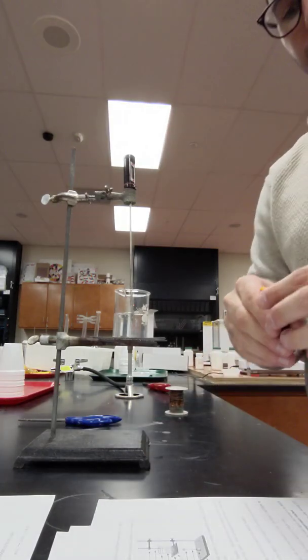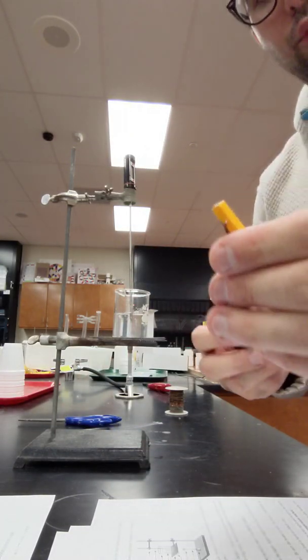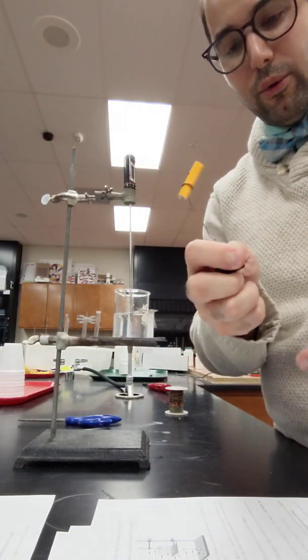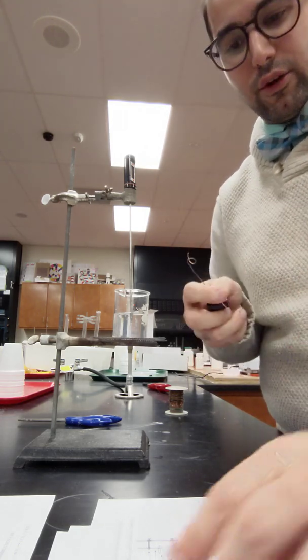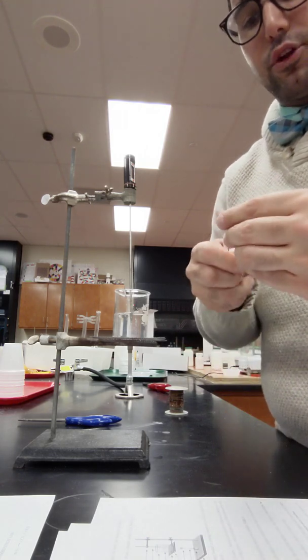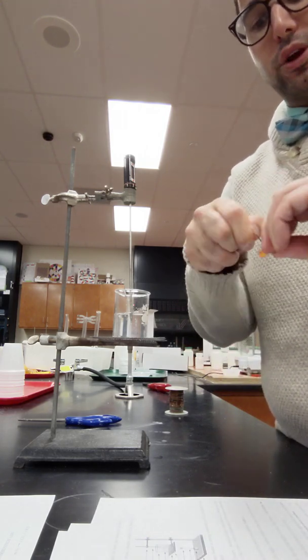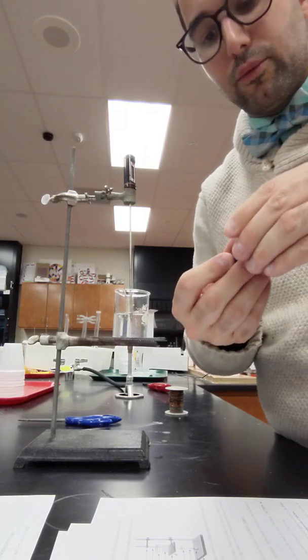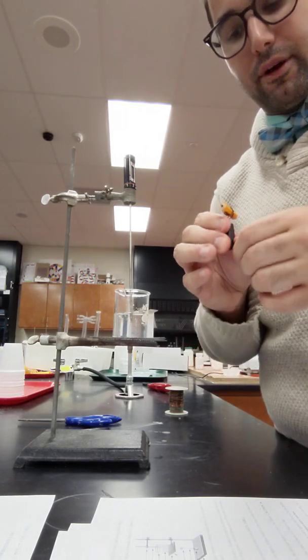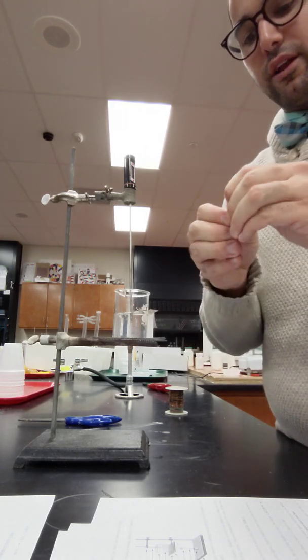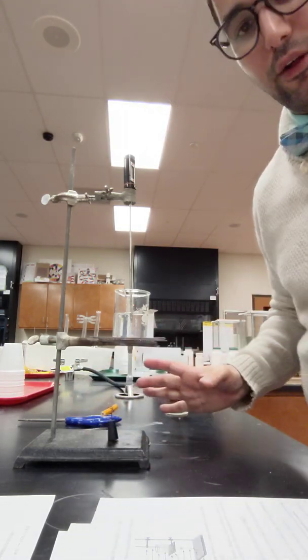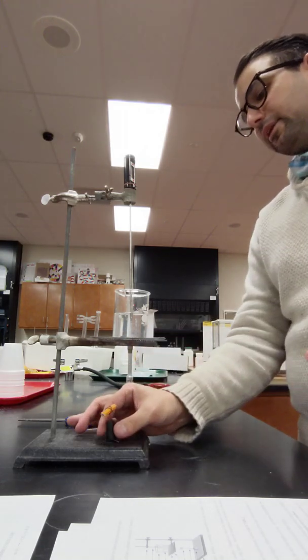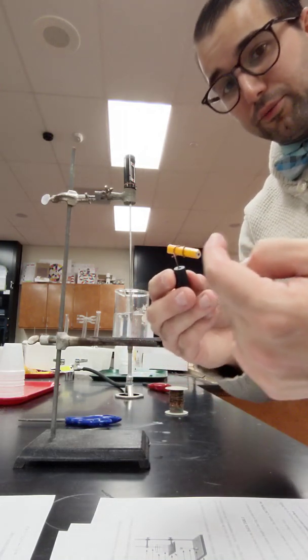What you're eventually gonna do is you're also gonna get a rubber stopper that has a hole in it. You can't really see that and we're gonna pretend like this pencil is the Cheeto. There's copper wire that you're gonna poke into the Cheeto because it's crunchy and you're able to get it into there. You're gonna poke into the Cheeto and then make sure it stays in the copper wire and then you're gonna put it right into the rubber stopper.